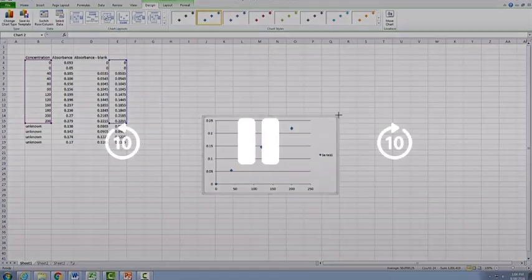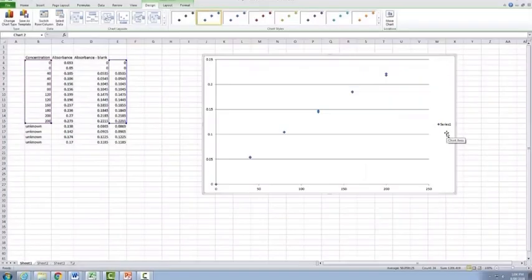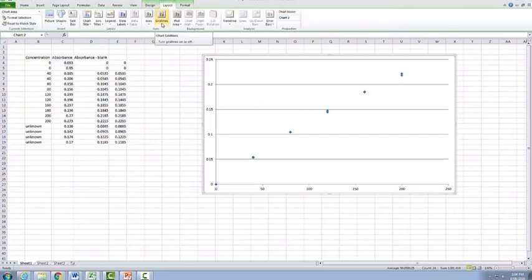As I personally prefer to always make the graph larger because it makes things easier when you're actually adding in your lines of best fit and also reading off your controls. As we only have one set of data, we don't need to keep the legend, so we can delete that off. The next thing we need to do is we need to make sure we add in our grid lines.